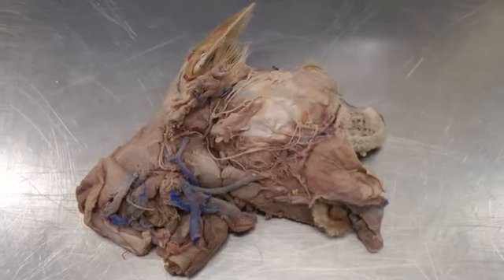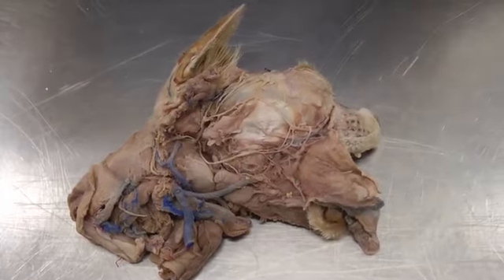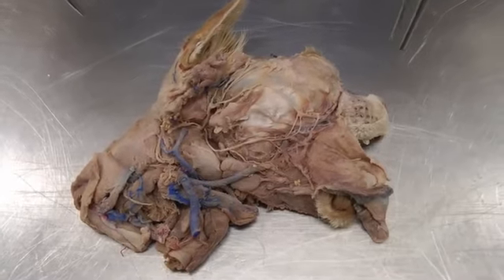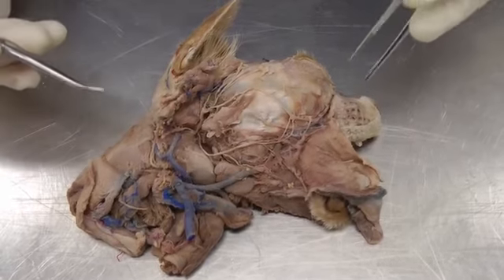This is lab 25 on the cat specimen. On the cat, things get a little smaller and are a little more difficult to see than on the dog. So some of the terms I may skip, the really small print, because either they're broken or not able to be seen on this cat, but I will do my best to show you what I can.